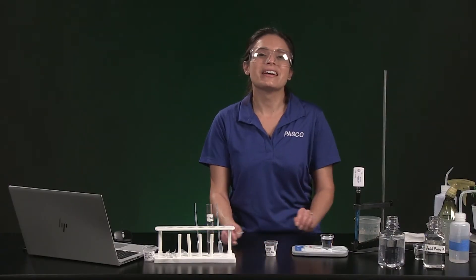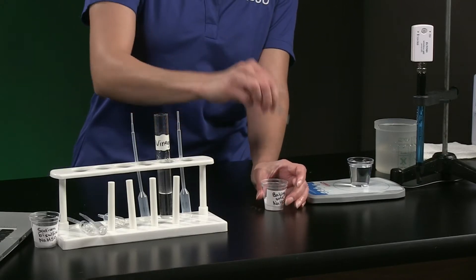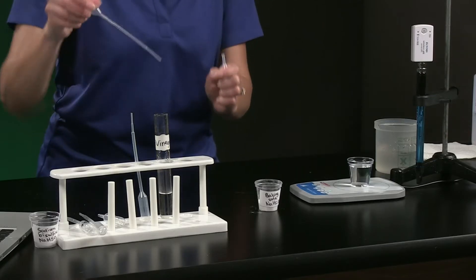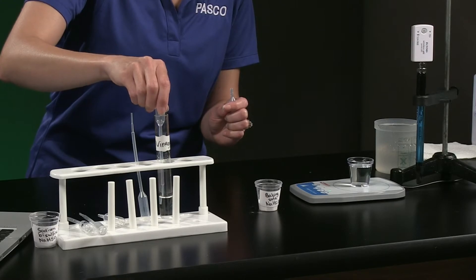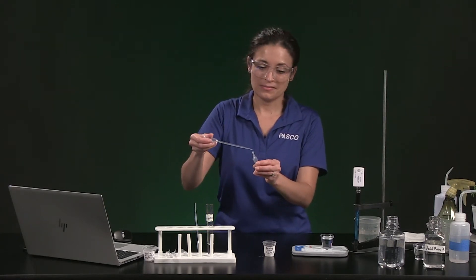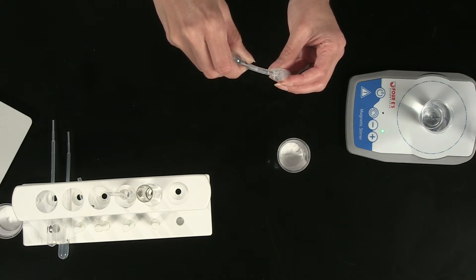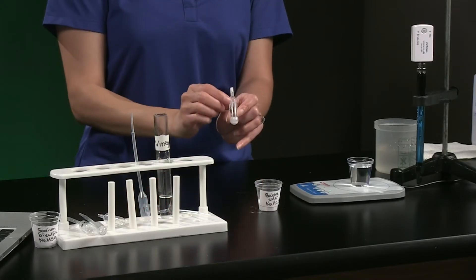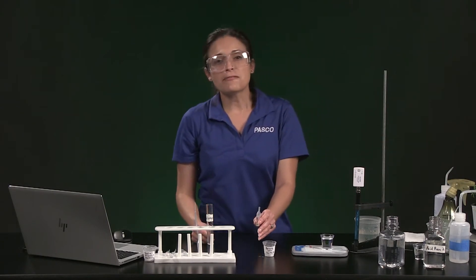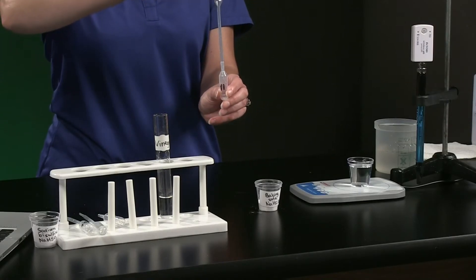For part one, we will see how the addition of carbon dioxide gas affects the pH of pure water. I am going to squeeze and hold pipette 1A and push it down into this cup filled with baking soda to fill the pipette with some baking soda. Next, I will fill pipette 1B with vinegar. Now I can insert pipette 1B into pipette 1A and squeeze to slowly let 20 drops of vinegar fall into the baking soda. This reaction is producing carbon dioxide, which you can see as bubbles. Once all 20 drops are in, I am done with pipette 1B. Now if I squeeze and hold pipette 1C and insert it into pipette 1A, I can use pipette 1C to collect carbon dioxide gas produced from the baking soda and vinegar reaction.